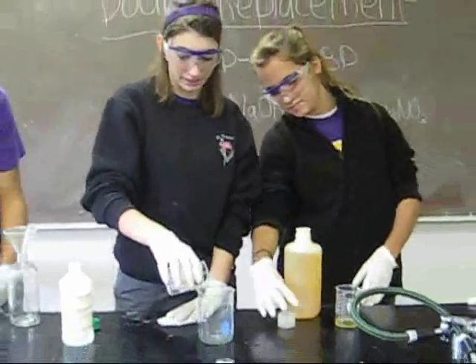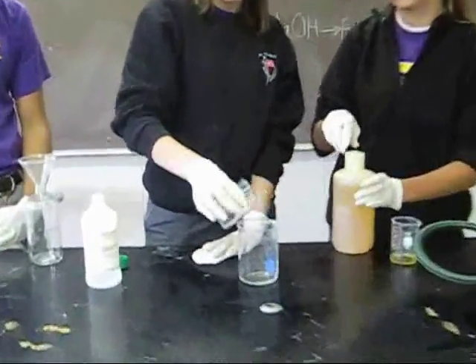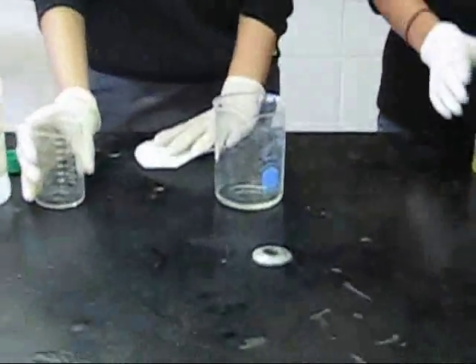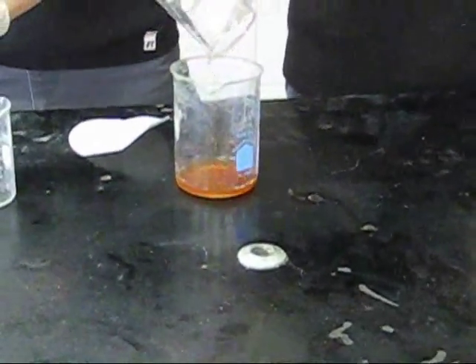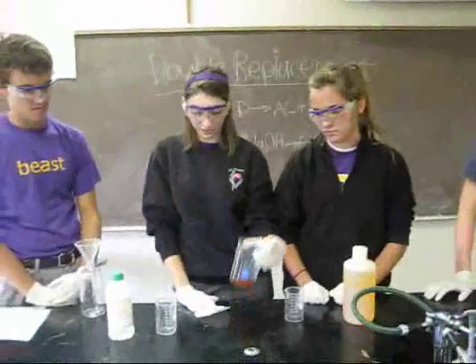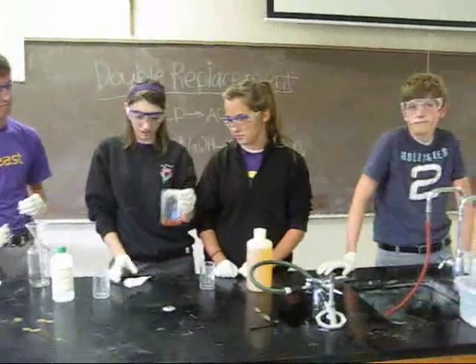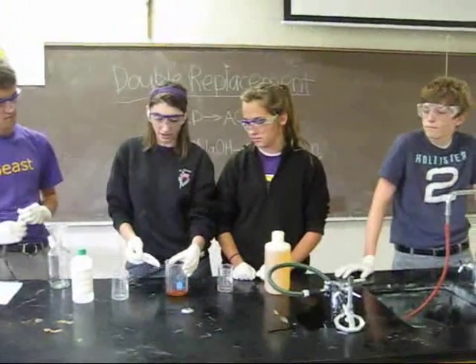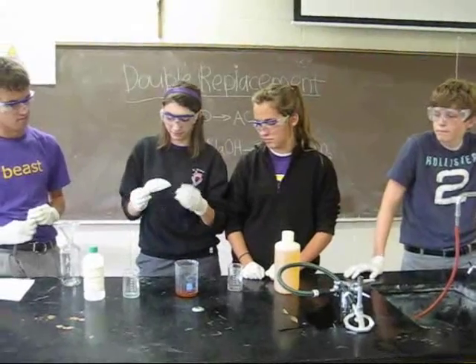We pour them together and you can see that a chemical reaction has taken place because there is a change in color and also a formation of a solid.